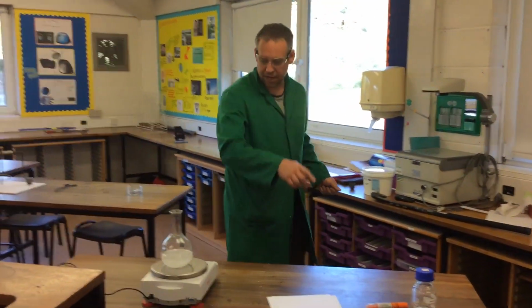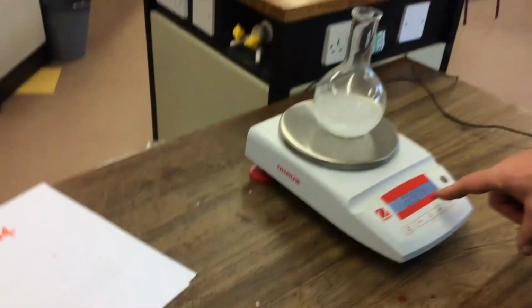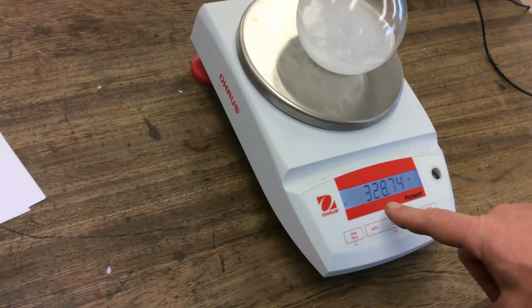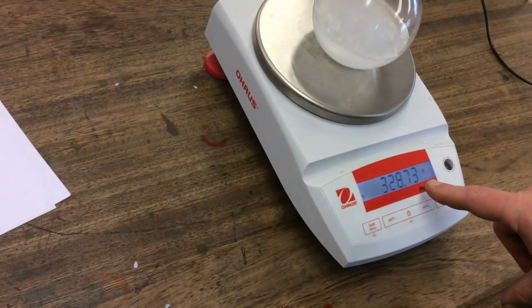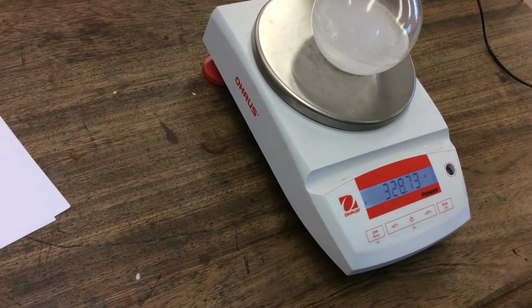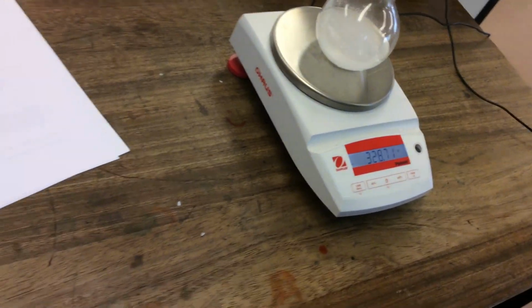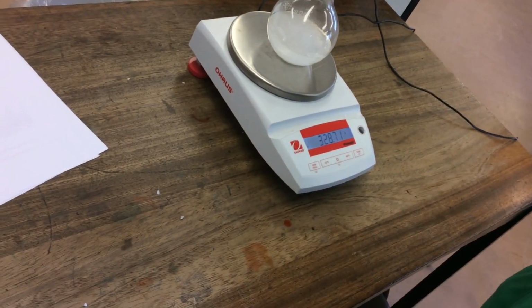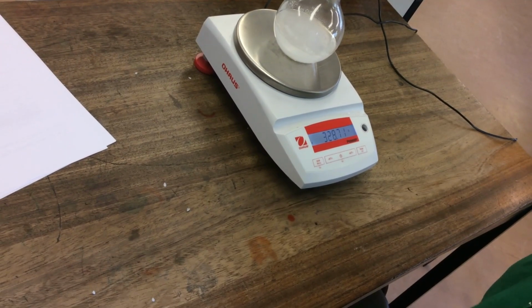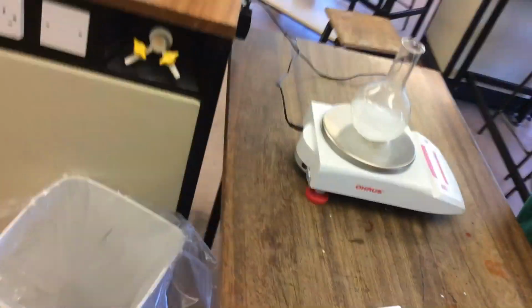If you come round here, I don't know whether you can see this, over here. It doesn't happen all that quickly, but we've got here a reading of 328.74, and you can see it's gone down to 7.3. Now if I wait, about every 20 seconds, it goes down 1, and it goes down again. It'll go down to 7.1 in a second. Now, last lesson I showed you a reaction where it gained mass. In this one, it's losing mass.